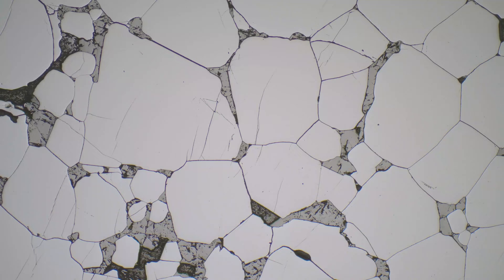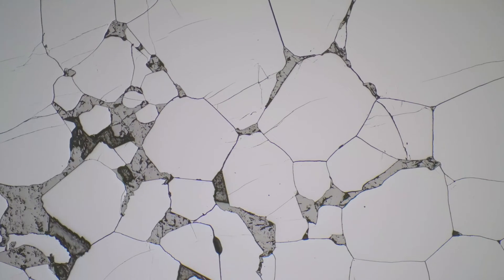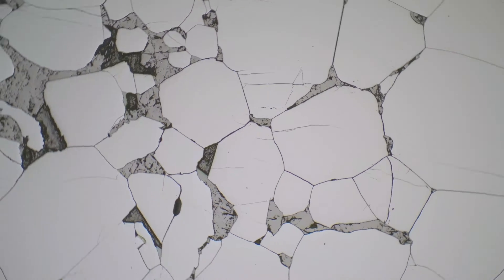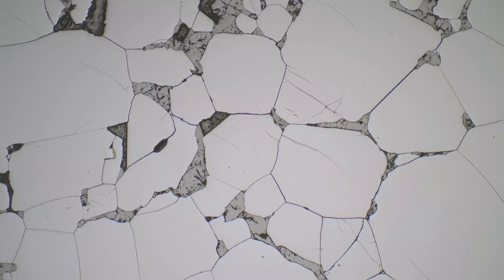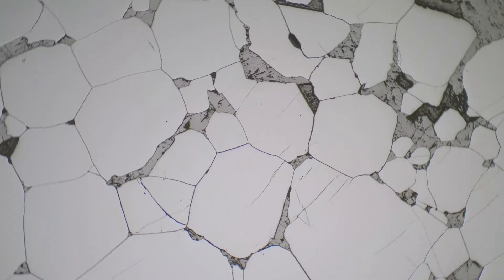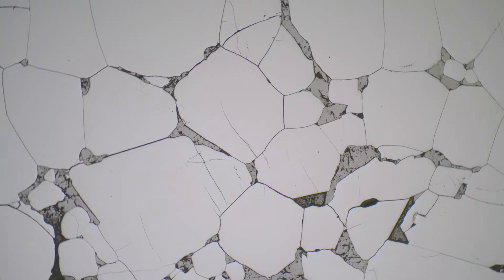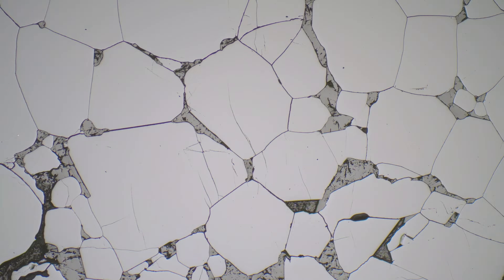Moving to other parts of the slide, you can see that they're pretty well-formed crystals with a fairly interlocking structure. Again, as we rotate the slide it's not changing colors. This is because it has a cubic crystal structure, so the light doesn't really change direction as it enters the crystal structure.